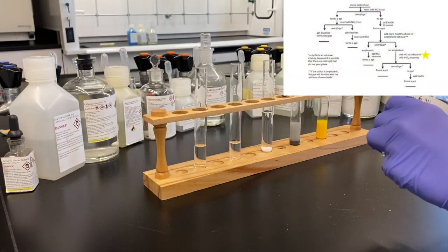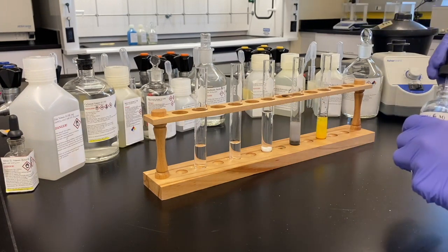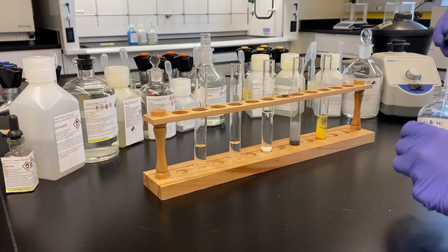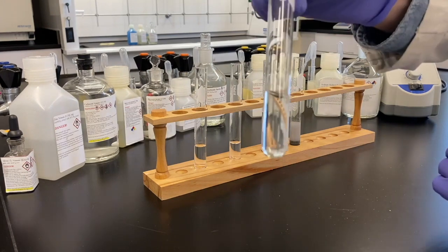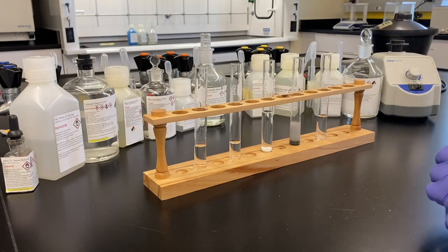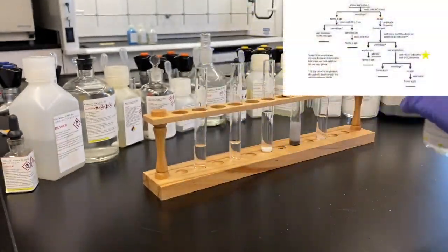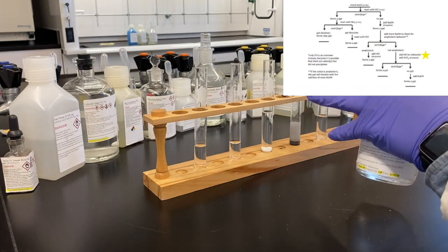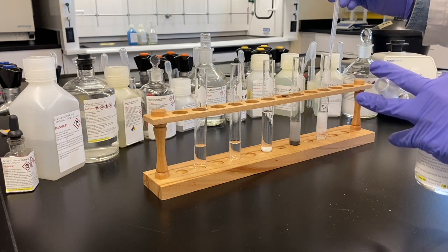We're going to add a higher concentration of acid to dissolve that. Now that we know it's on that side, we want to get the aqueous solution back and see how it'll react with tin chloride. So we've got back our mercury 2 aqueous now. And we're going to add our tin chloride. Looks like a snow globe.